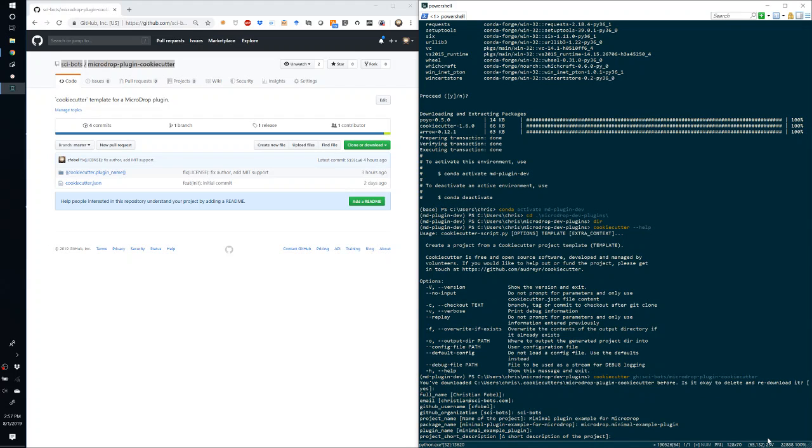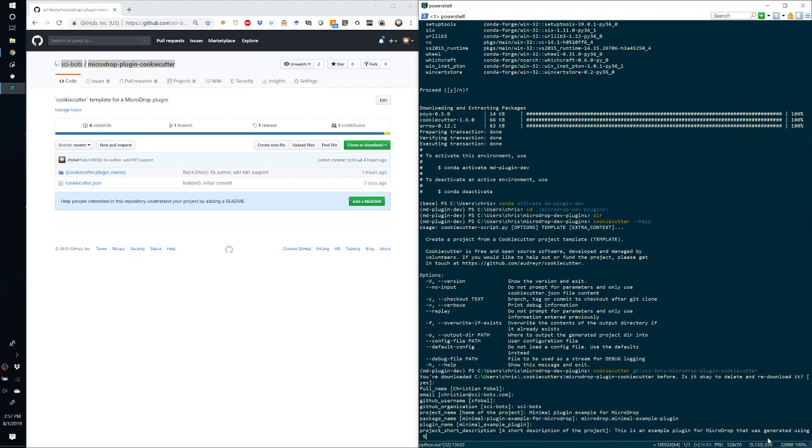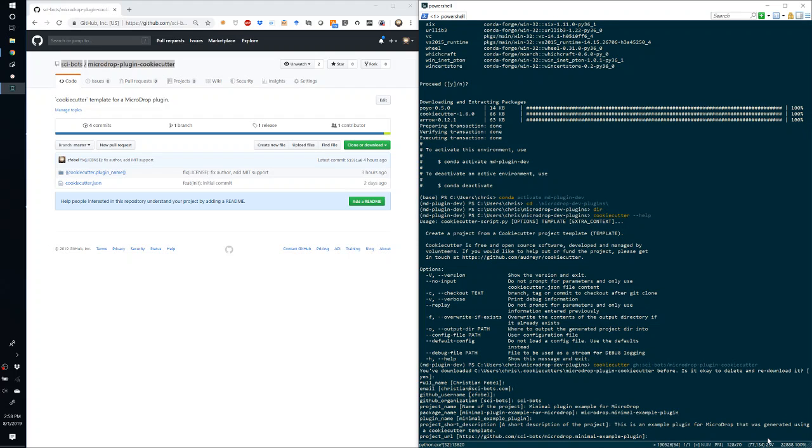And then we can enter in a short description, which will be filled in the README file that's generated. So for example, we can say this is an example plugin for microdrop that was generated using a CookieCutter template. The project URL is automatically filled in based on your organization for GitHub, or if you haven't specified an organization, using your GitHub username, as well as the package name. So that's the default. You can always override it.